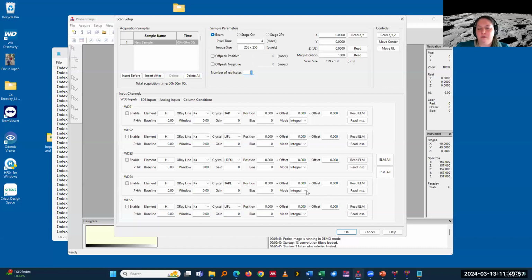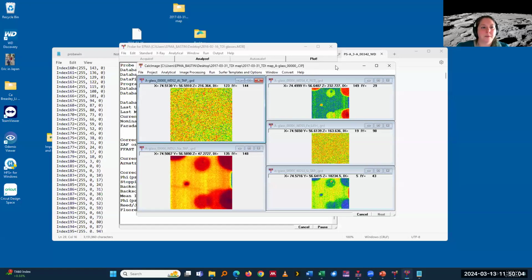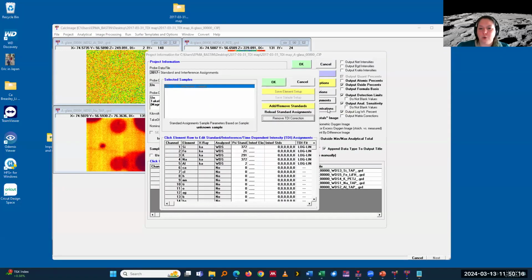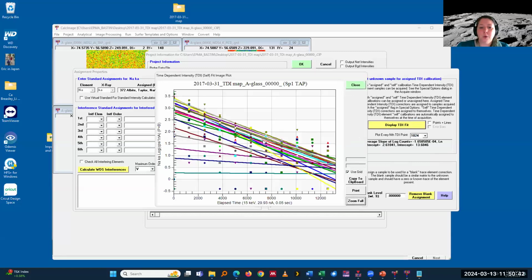You define your area and say how many you want to have of that. And then when you go into CalcImage, here is the glass data. You go into quantitative parameters, then standard assignments, very similar to what I showed with the point data. You have the option, when you click on the respective element, to pull out the data here and visualize TDI fits. Because maps have many, many different pixels, you can sample either every 64th, 128th, and so on. Then I can actually see the data and look at what might be the best fit.